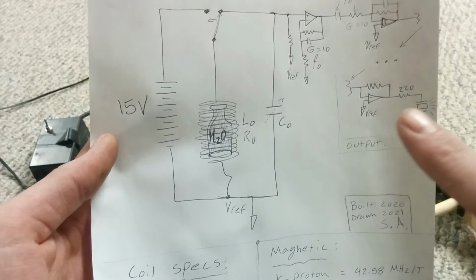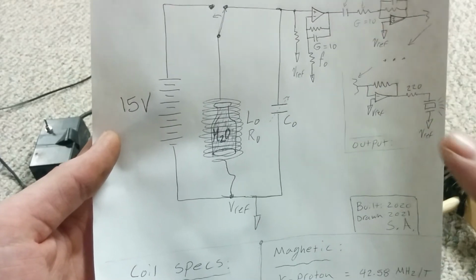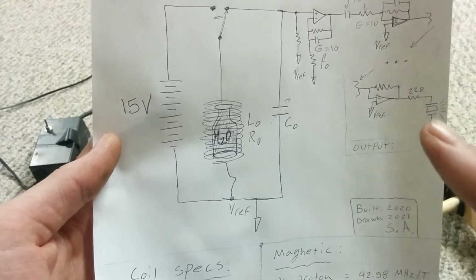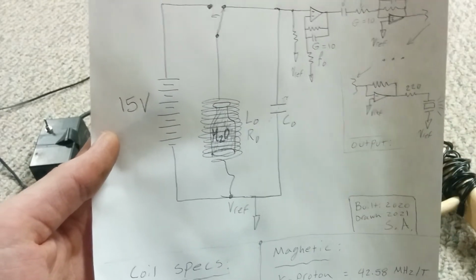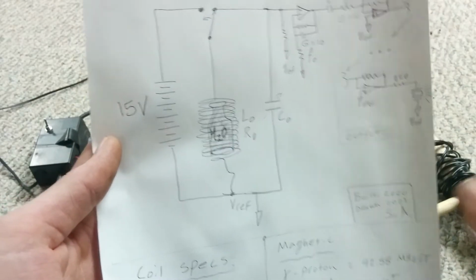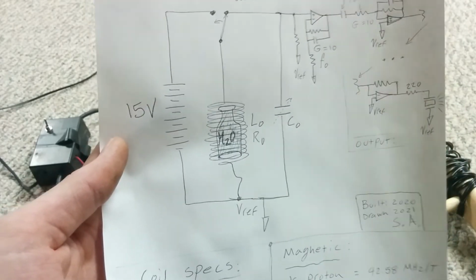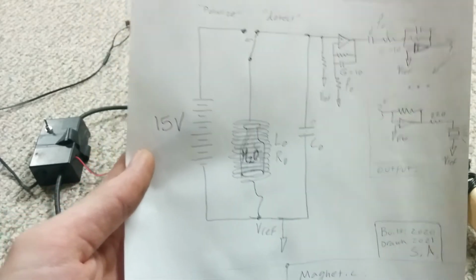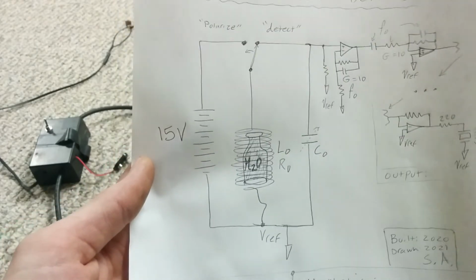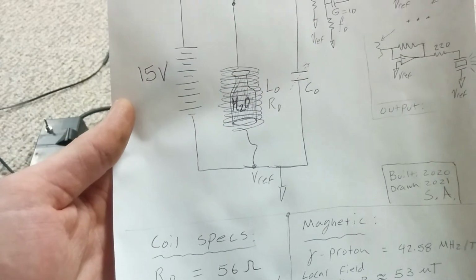And then I'm also driving it through some resistor. I don't think it was 220. That's where I started, but I think I dropped it down to 47 or something like that. And that's because the piezo is a big capacitor too. You can cut off the higher resonances, or roll them off a little bit, right? And it also means your amp isn't strained too hard in the worst case scenario. So that's worth playing with too. And yeah, I think that basically covers everything there is.